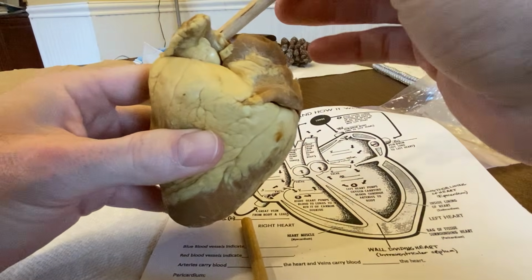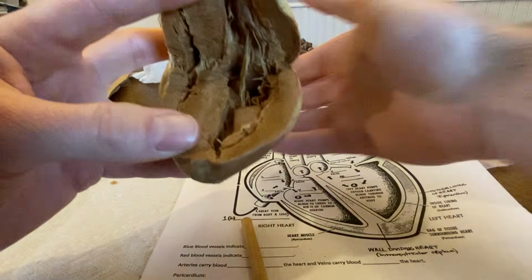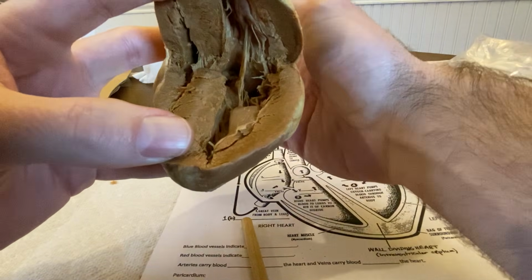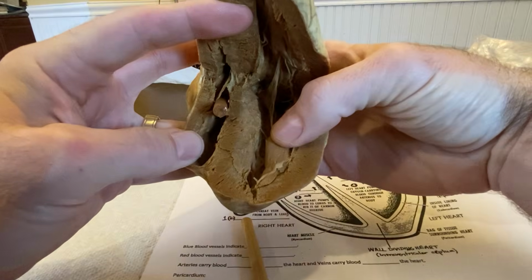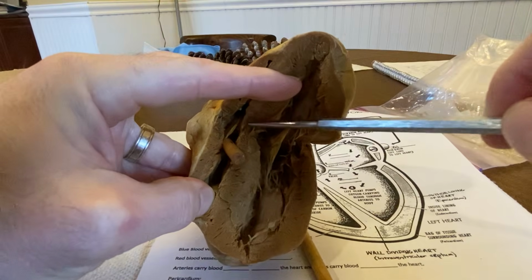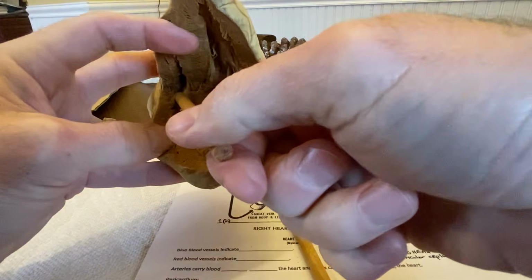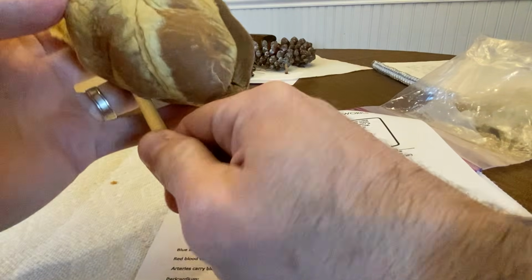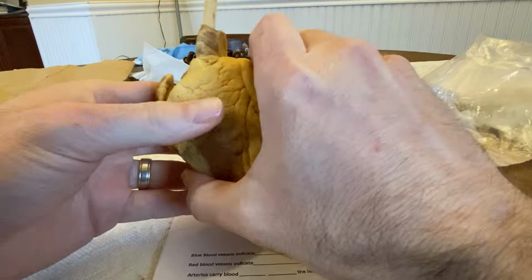Right atrium, when that contracts, is gonna squeeze the blood down through the tricuspid valve, which we're coming through right here. We're kind of simulating blood with this wooden dowel coming through that tricuspid valve. You can see the valve here, like the little parachute on this side, okay, and here, coming through, filling the ventricle, okay, and then when that ventricle contracts, it's going to push the blood up and out the pulmonary artery, which is a little struggle to get there. Okay, so here we go, out the pulmonary artery, kind of stuck at the top.